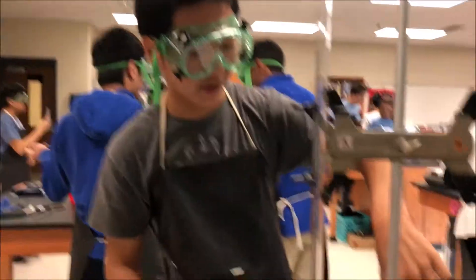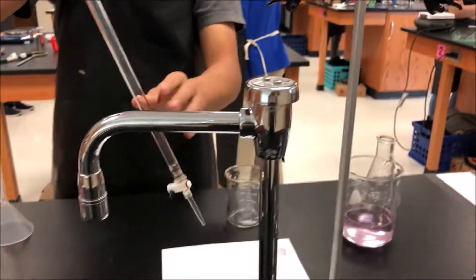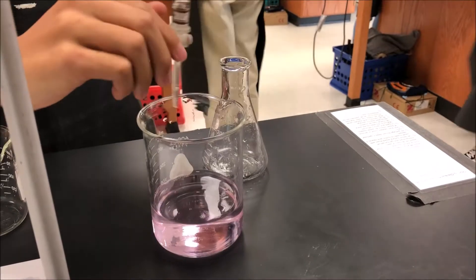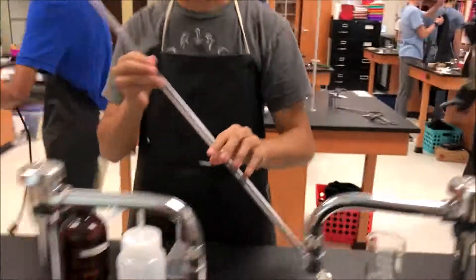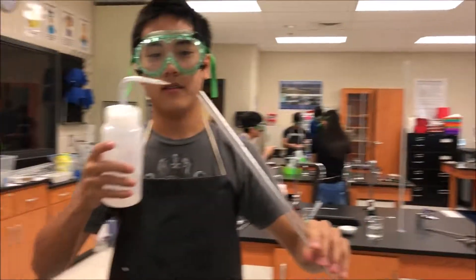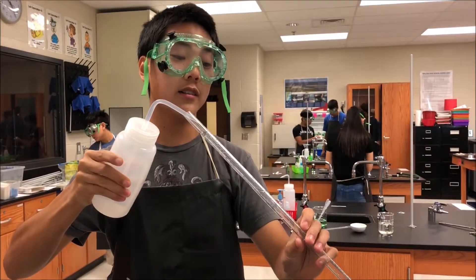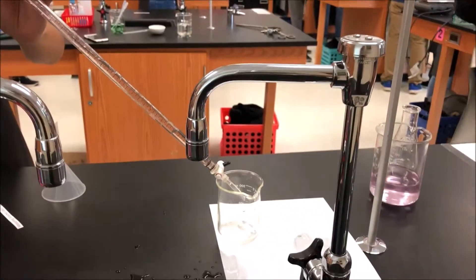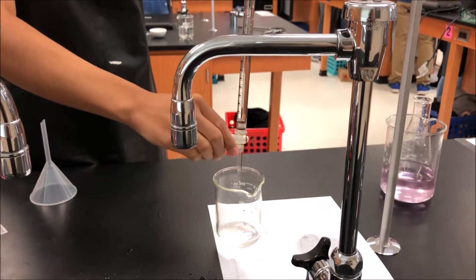When you're done with the titration, you're going to want to put all of the liquid substances into the waste beaker, or the place directed by your instructor. Then you're going to want to take off the burette and drain the remaining liquid, which for us is practically none. There we go. And then you're going to want to clean the burette with the same procedure as before — tilt with deionized water so it covers all sides of the burette. After you do this, drain and repeat several times until there's no water on the sidewalls of the burette.